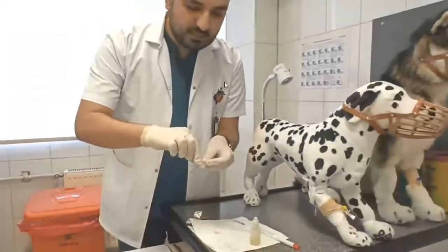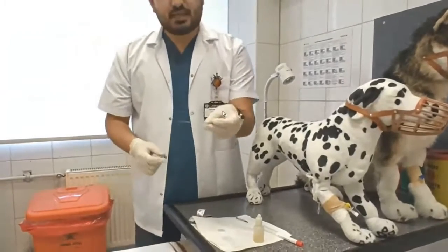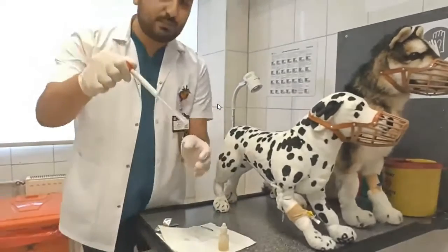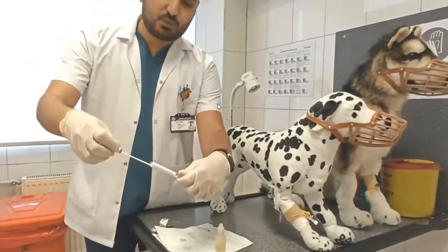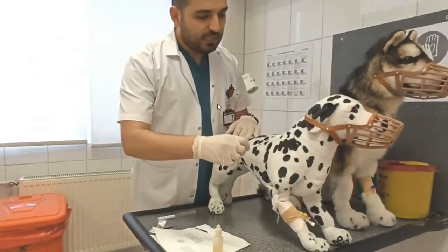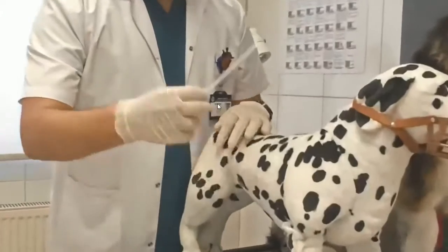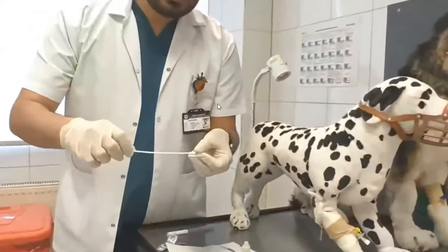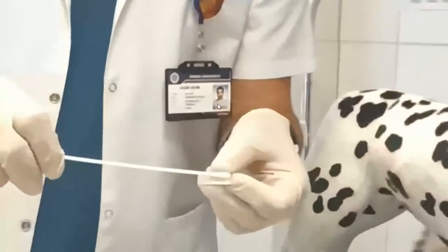After this, put another slide on it and let's do the examination. This is a sterile swab — as you see here, I open it now, and contact the swab to the site to get a sample from the lesion like this, rolling. Then also roll the swab on the slide like this. Before the examination, it's ready.